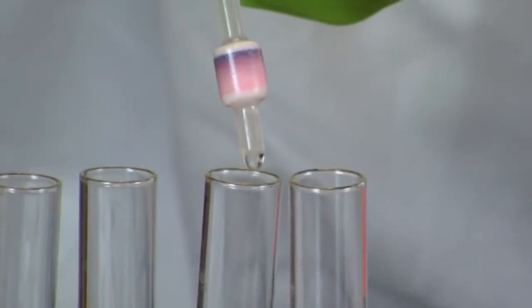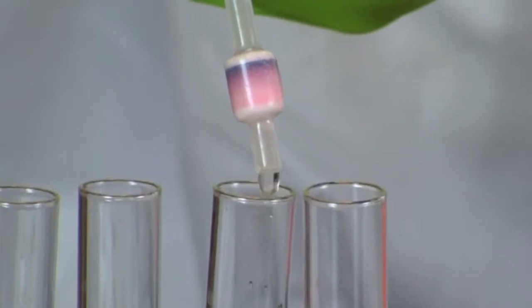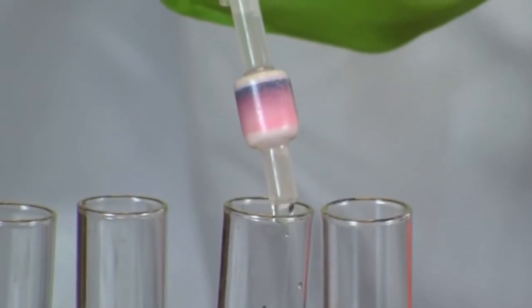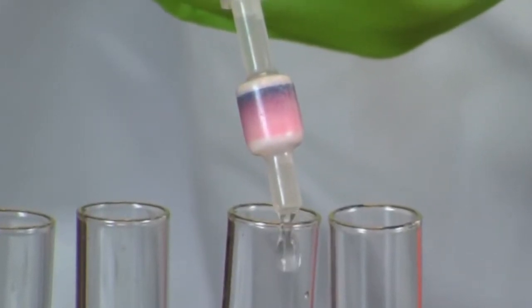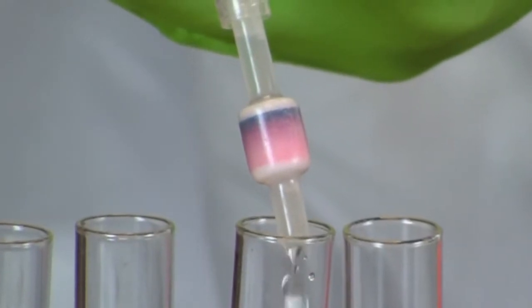Notice what is happening to the Kool-Aid pigment during this step. You will need to repeat the 5% 2-propanol wash until the flow through is clear. Collect each fraction in a separate test tube.